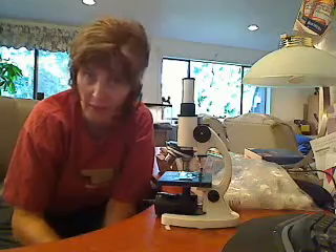Good morning. We're going to look a little bit this morning at how to use the microscope. My understanding is some of the slides that you received are not very good quality, so we're going to learn how to make our own.